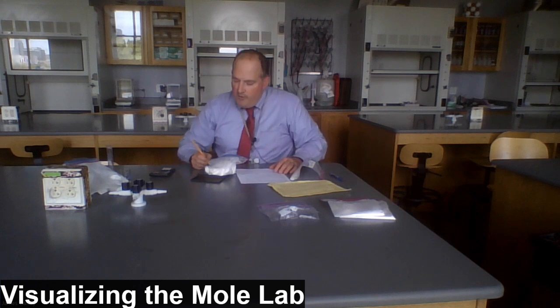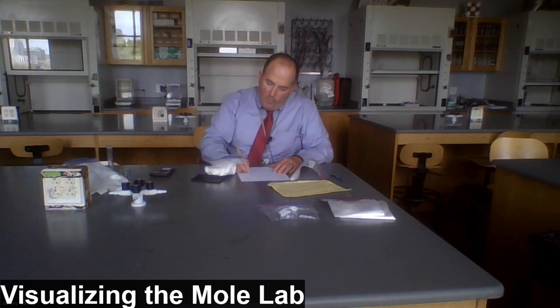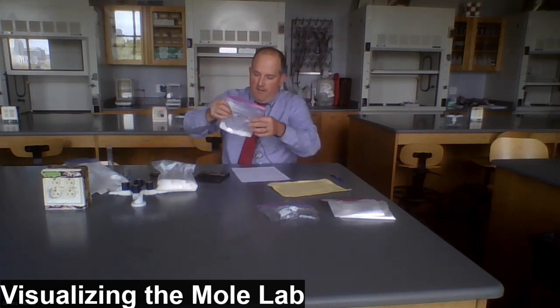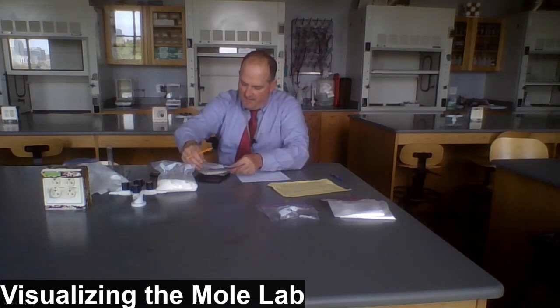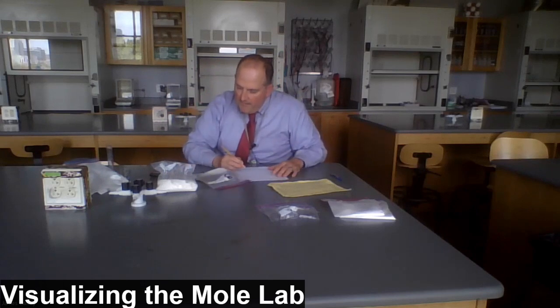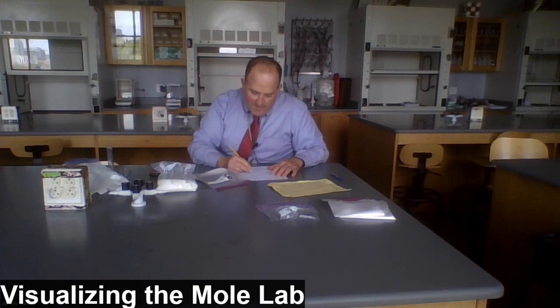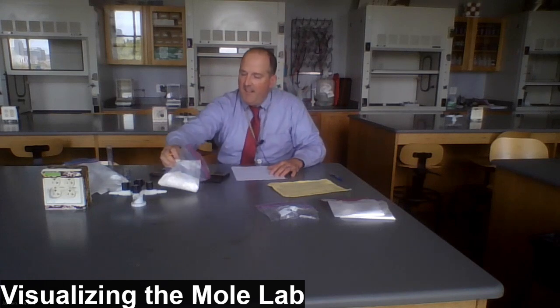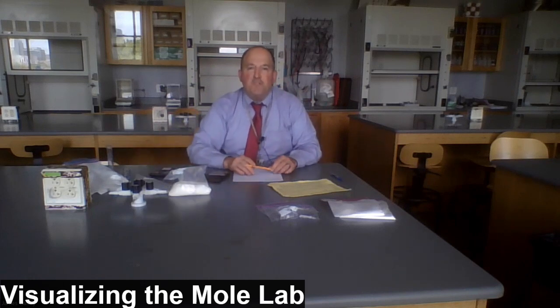I get 329.5 grams. 329.5 for sample A. Sample B, if I set this one on the scale, I'm getting 57.6 grams for B. Okay. Now we'll pause and do some board work to confirm their molar masses.